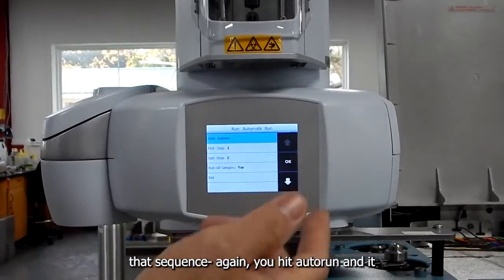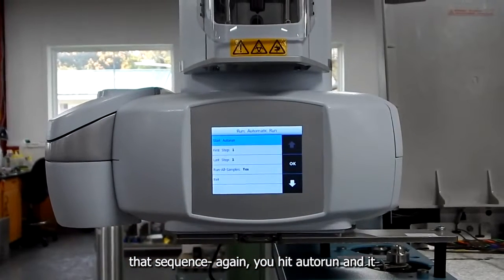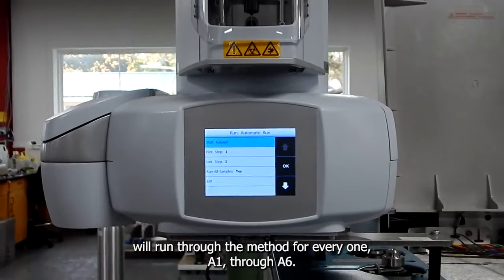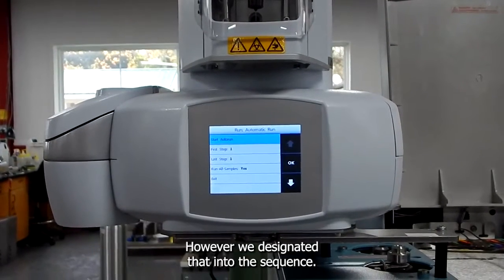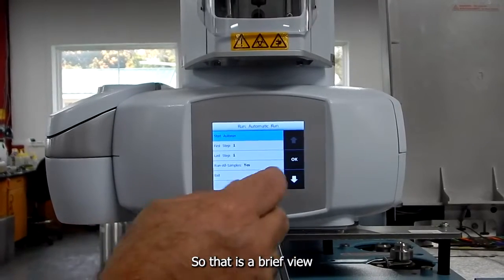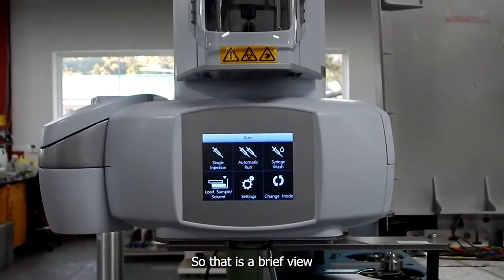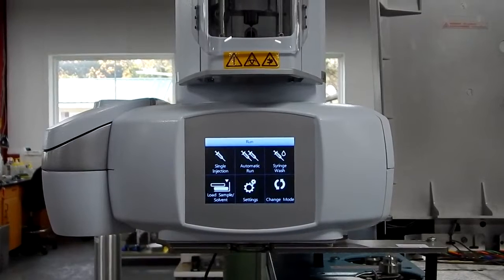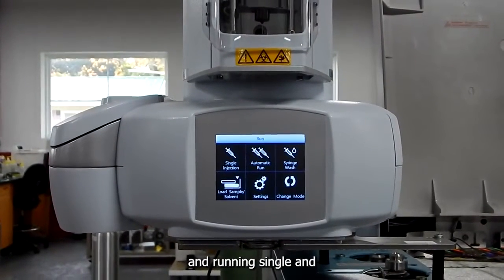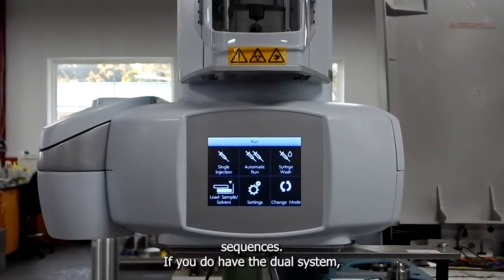And so to start that sequence, again, you hit auto run, and it will run through the method for every one, A1 through A6 or A6, however we designated that into the sequence. So that is a brief view of setting up the instrument and running single and sequences.